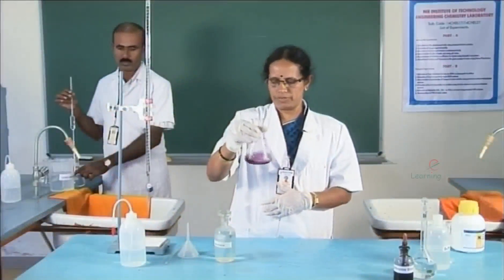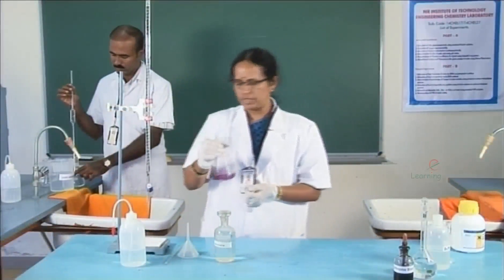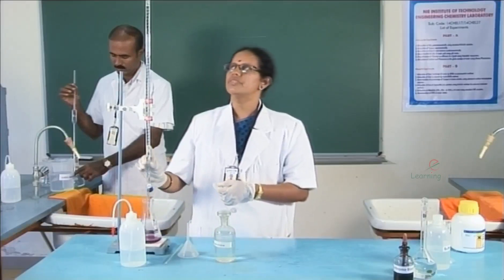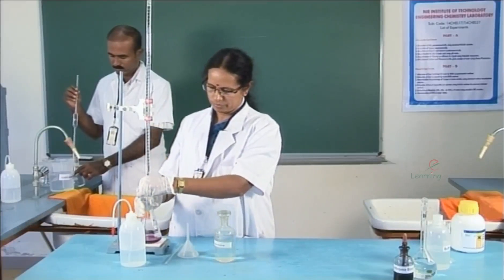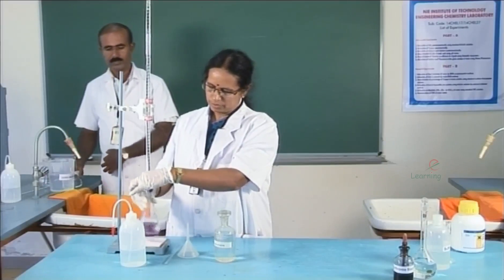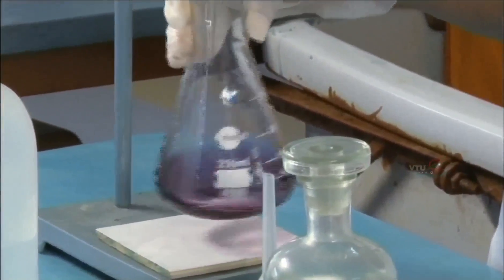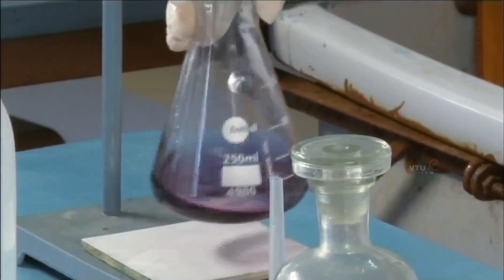The solution turns wine red due to the complex formation between the metal ions and the indicator. Now, titrate this solution against EDTA taken in the burette. The first reading is 0. Now add the solution slowly to the conical flask till the end point is reached.